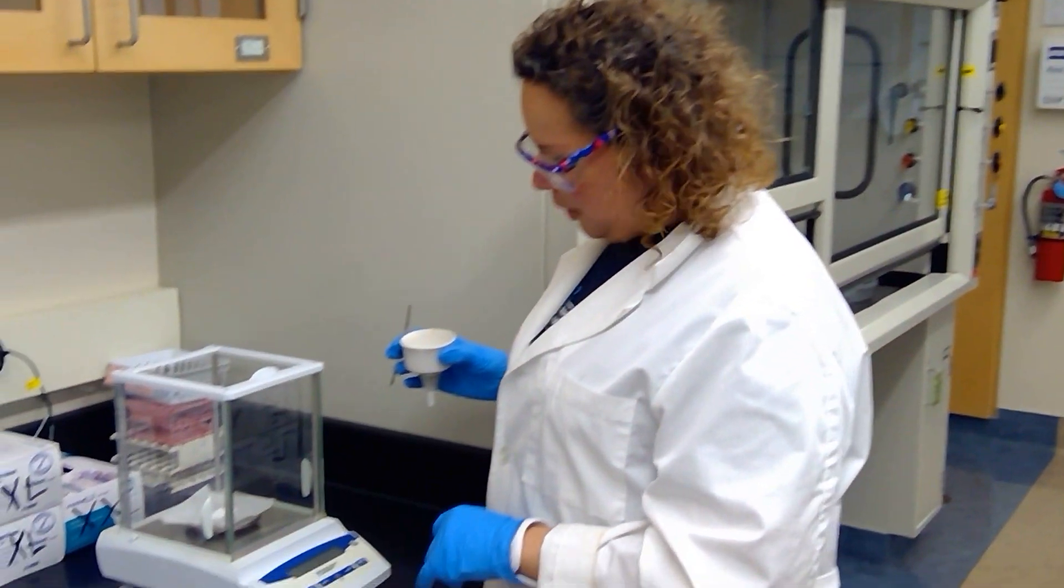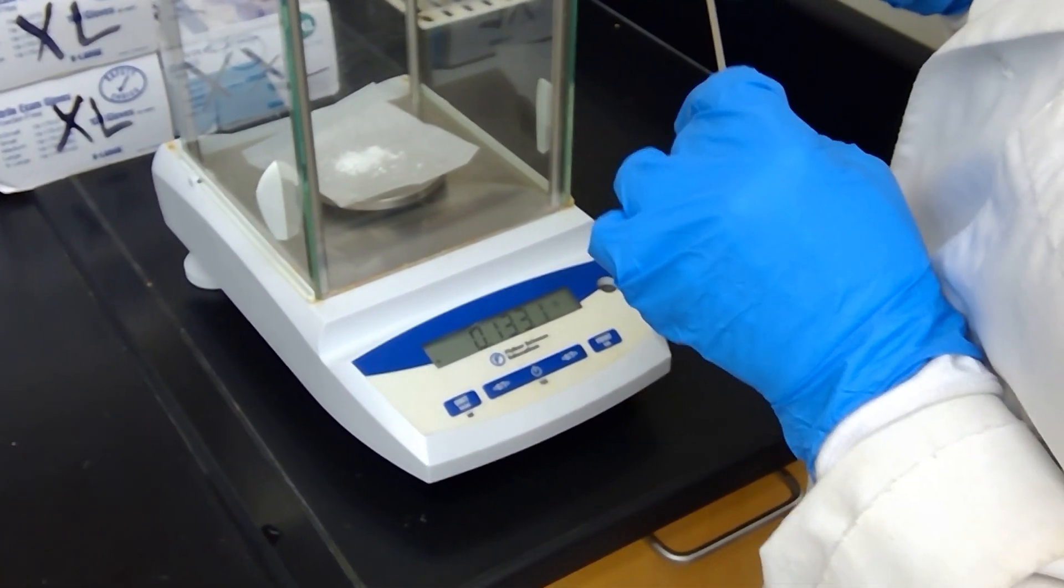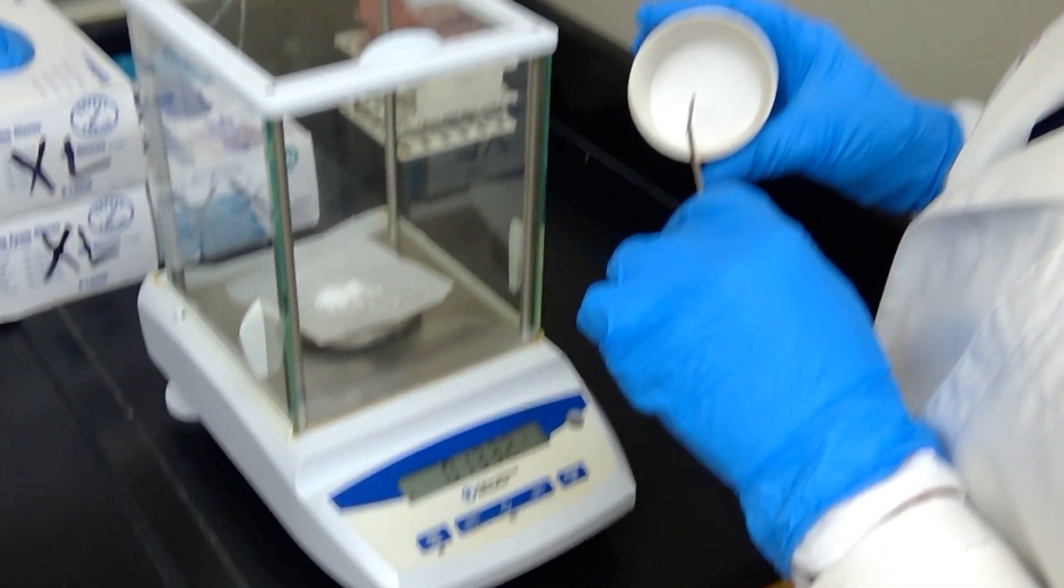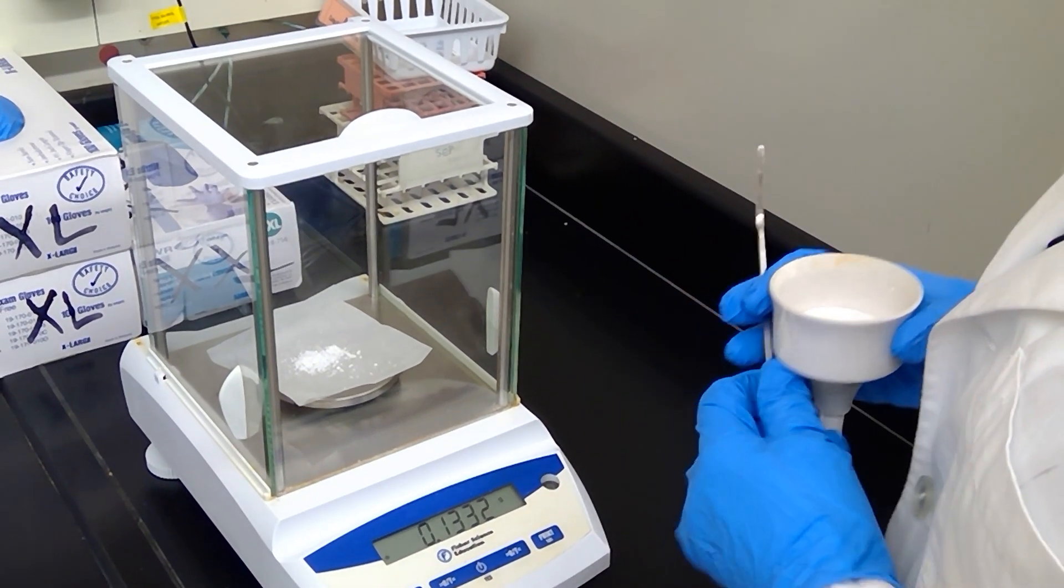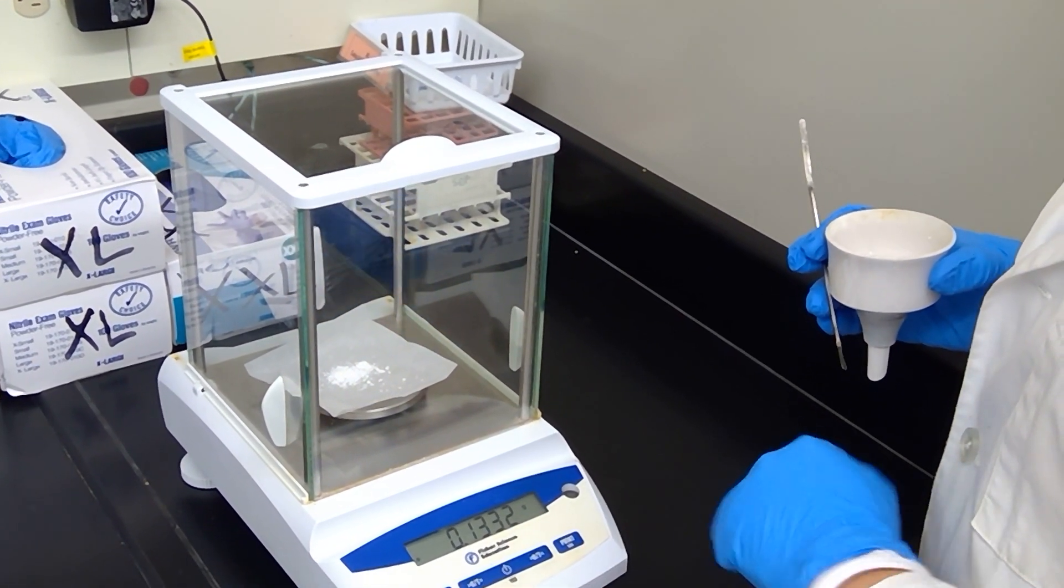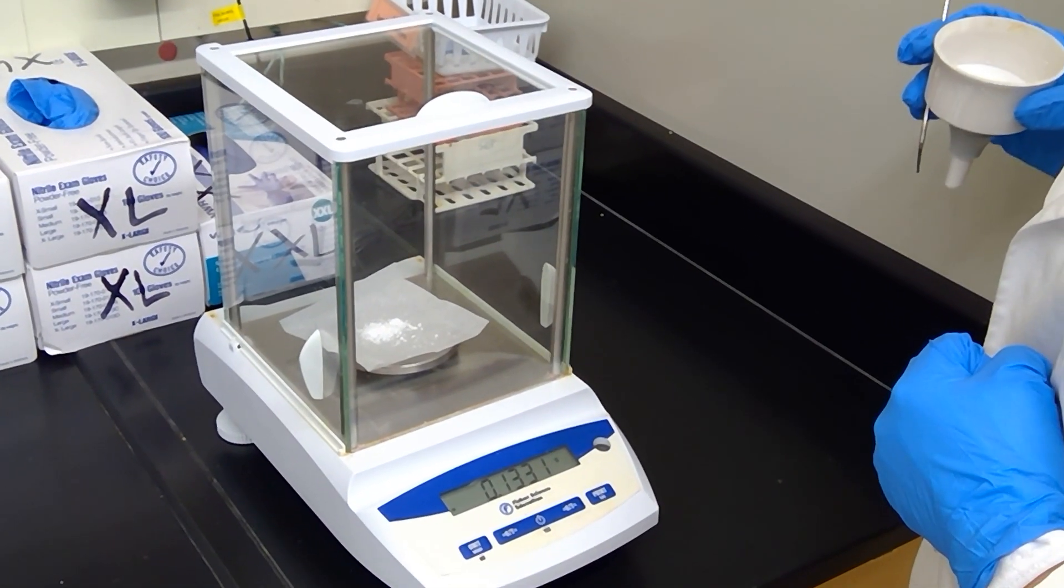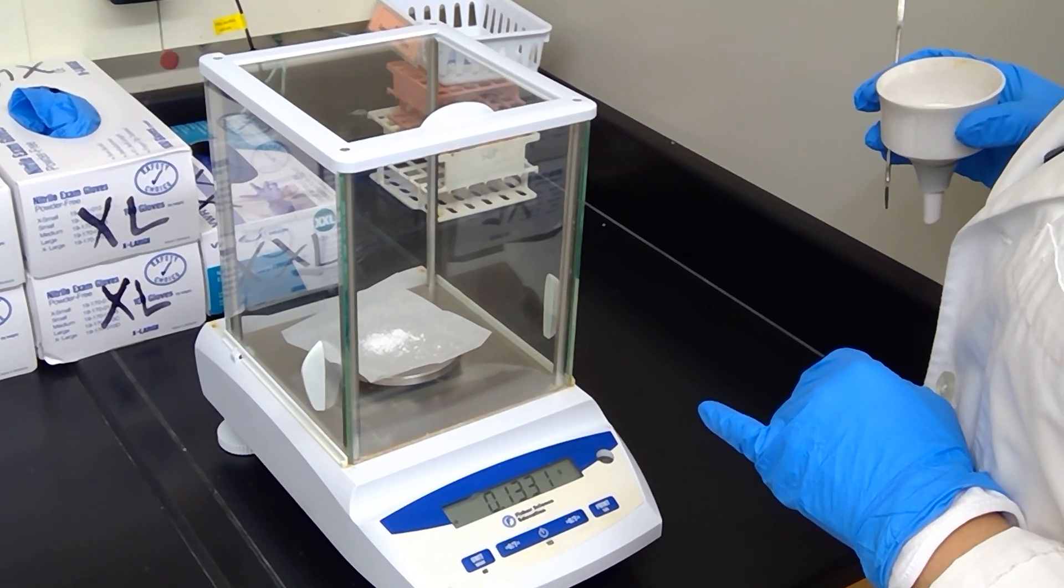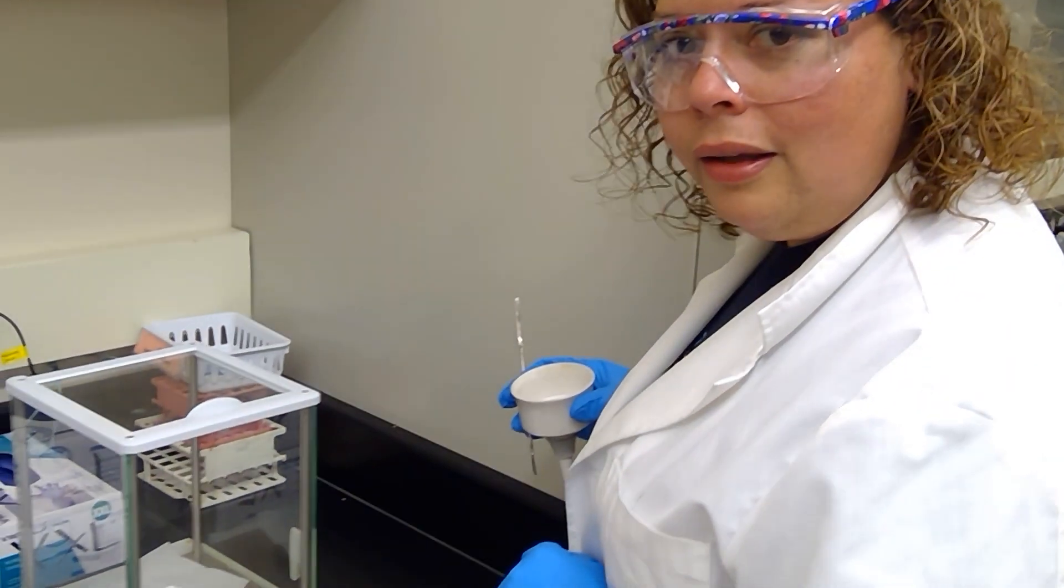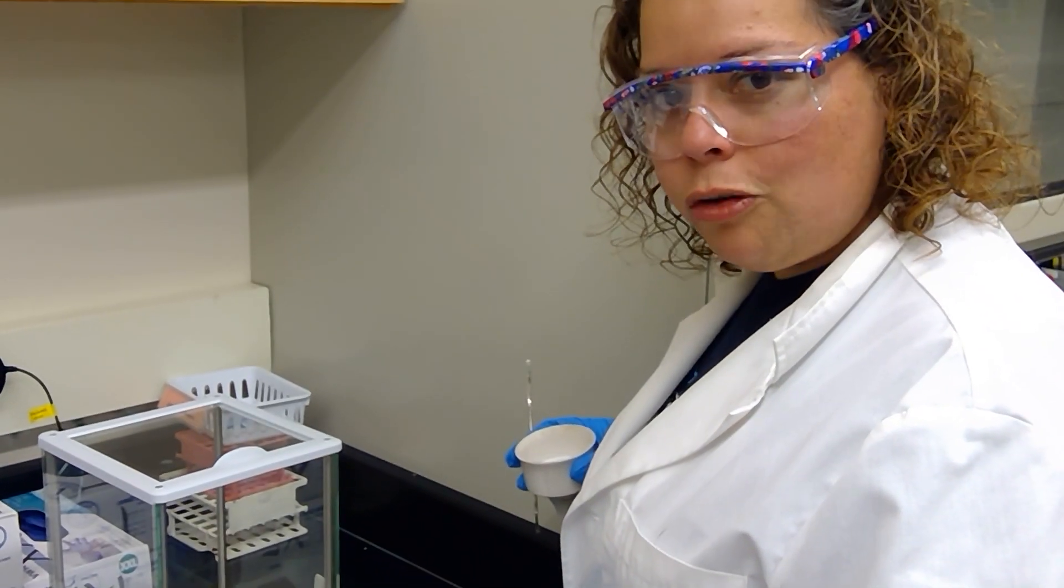Students, we have measured out the amount of solid that I could scrape out of my Buchner funnel and filter paper. We do have a little bit of product loss because I wasn't able to scrape everything out. But we see that we have a mass isolated of 0.1332 grams. I will give you a little synopsis card in just a moment. We're going to skip over the recrystallization portion and test this compound at the infrared, see how well it matches to a standard infrared of benzhydrol.